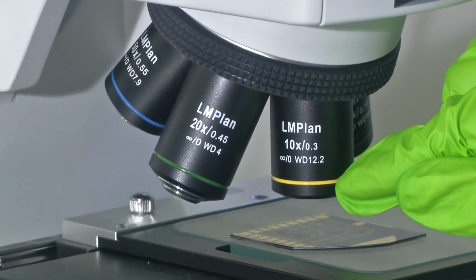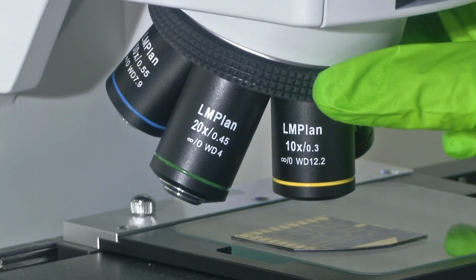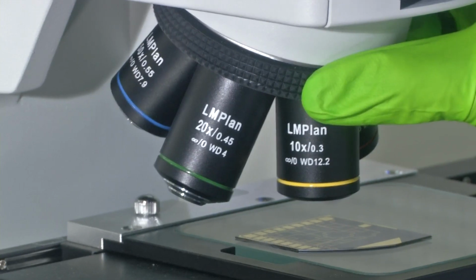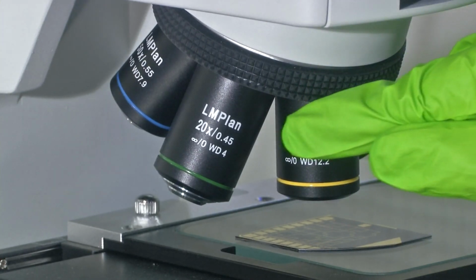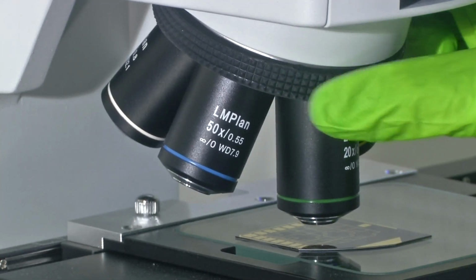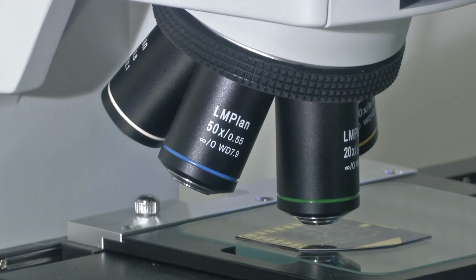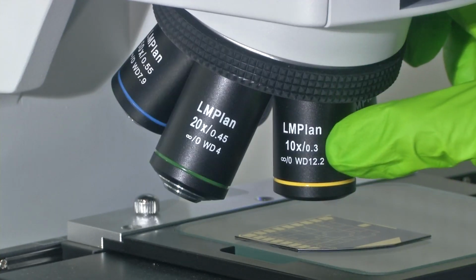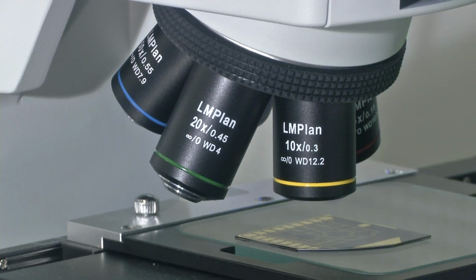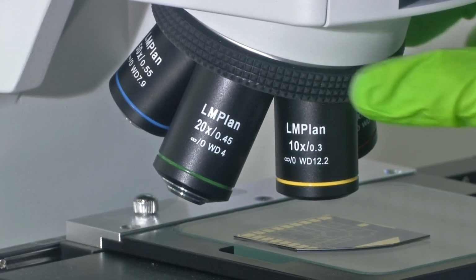If you can notice, each of the objective lenses has been provided with a different color strip for easy identification. And then you have the 20x, and as it sits, there is a click which ensures the objective is sitting properly. And now the turret is holding a 10x objective lens. So, the entire system could offer you a 10 into 10, 100x magnification for the sample which you are viewing.